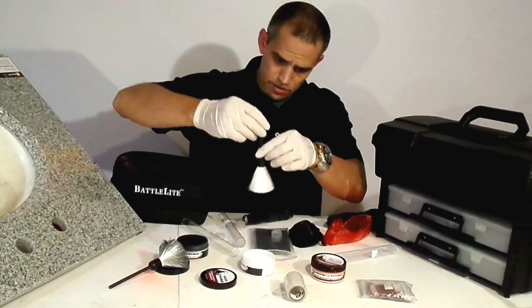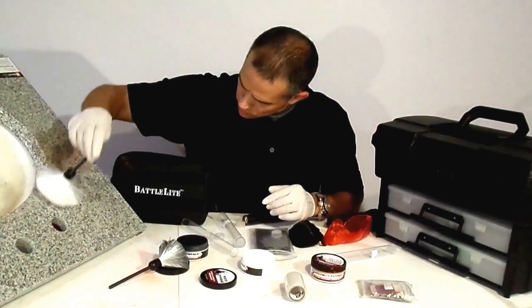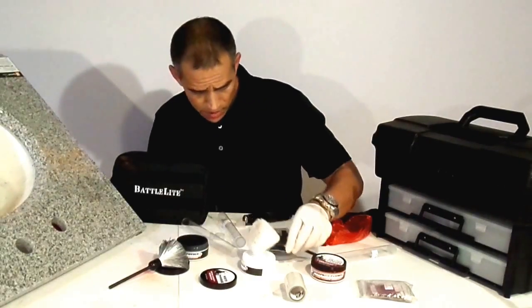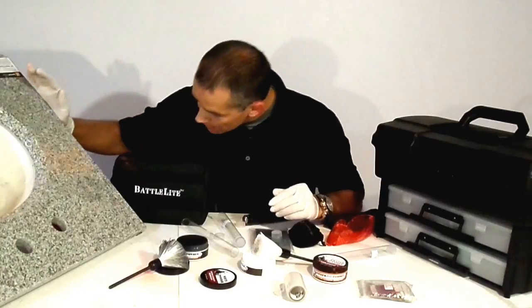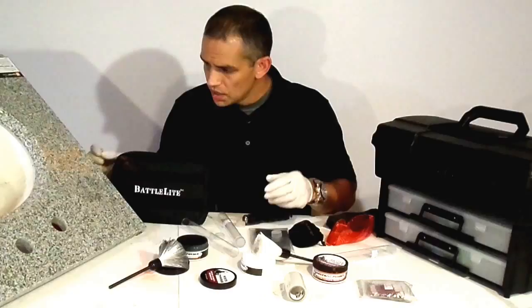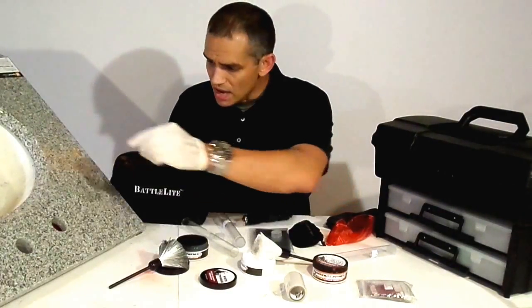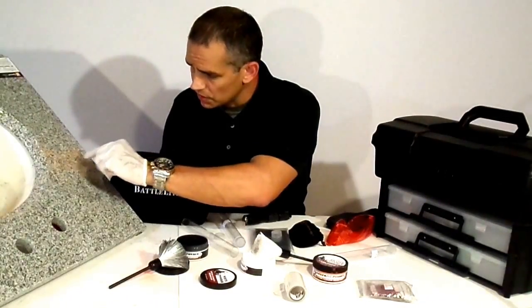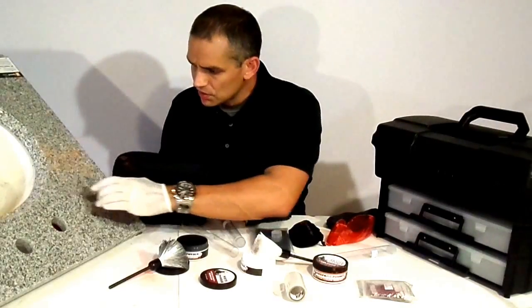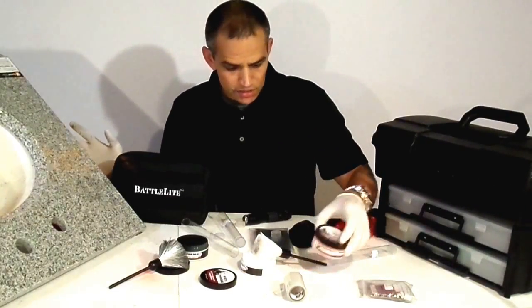Nice new brush — just a little bit there. Now I'm going to do the white. I can't see, and I know I put some nice sebaceous prints on here, but I can't see where those fingerprints are — they're really not popping. So I'm going to zoom in on this material so you can see the difference between those nice bright orange prints, the black prints, and the white prints. This was a great exercise to see the fluorescent powder.